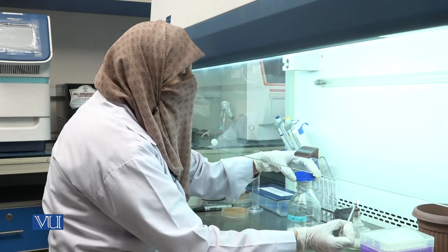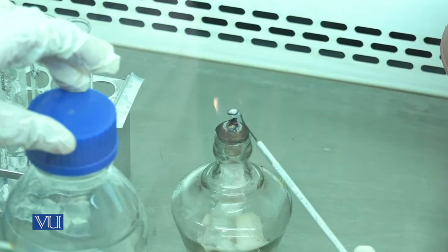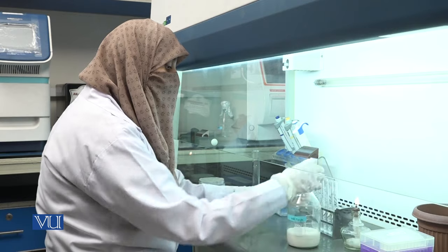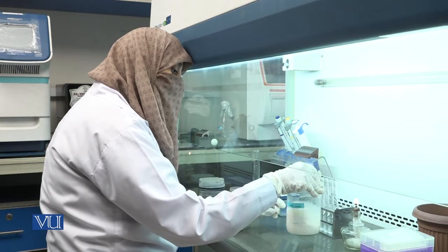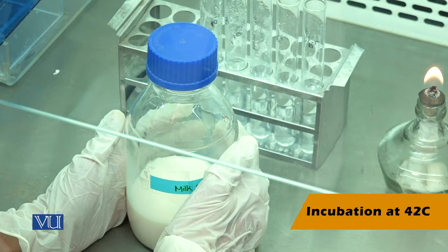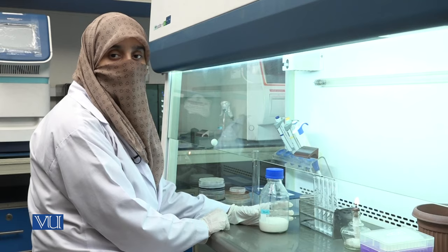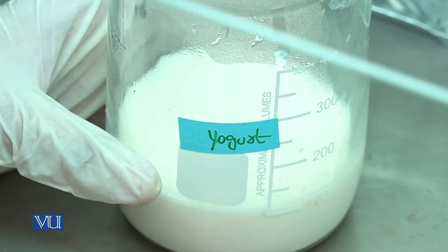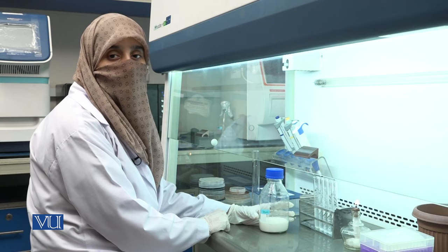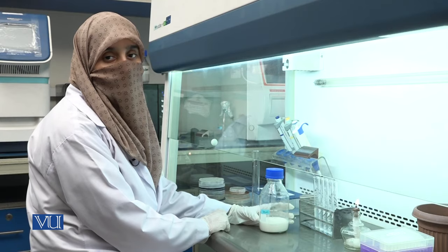After inoculation, flame the loop red hot again. Now mix the sample properly and place it in an incubator at 42 degrees centigrade for four to six hours. After incubation, yogurt is prepared by the fermentation of lactose into lactic acid, commonly produced with the help of Lactobacillus species, most commonly Lactobacillus bulgaricus and Streptococcus thermophilus.